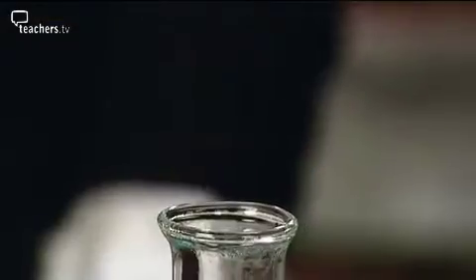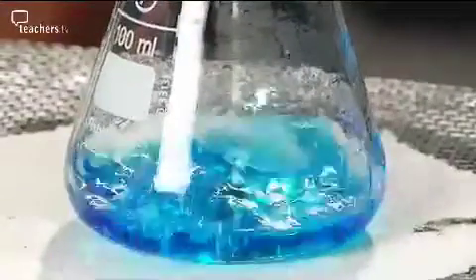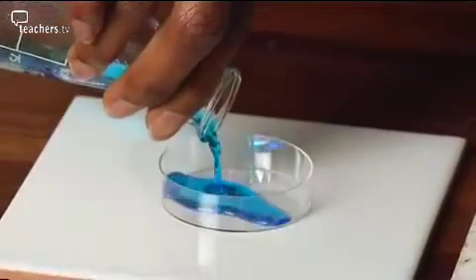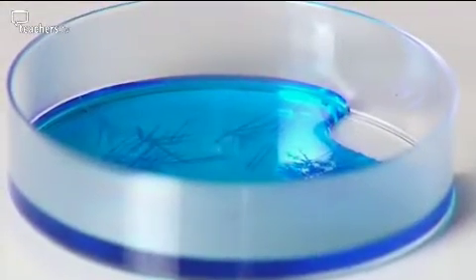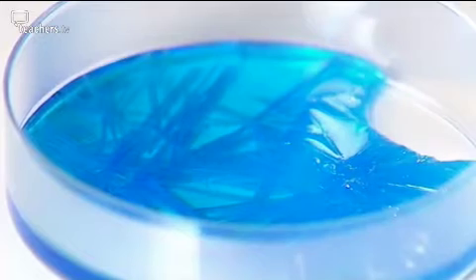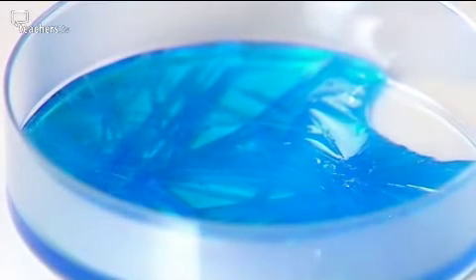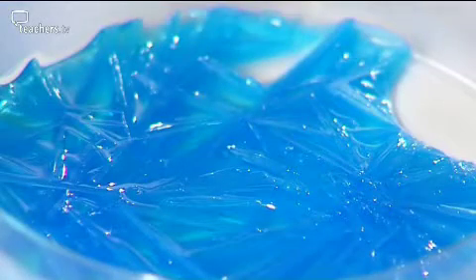Boil the solution in a conical flask rather than an evaporating basin for 2 minutes exactly. As soon as the flask is cool enough to touch, pour the solution into a Petri dish and watch the crystals form. Oh my goodness me, that is fantastic. It's beautiful, yeah. That is really good.